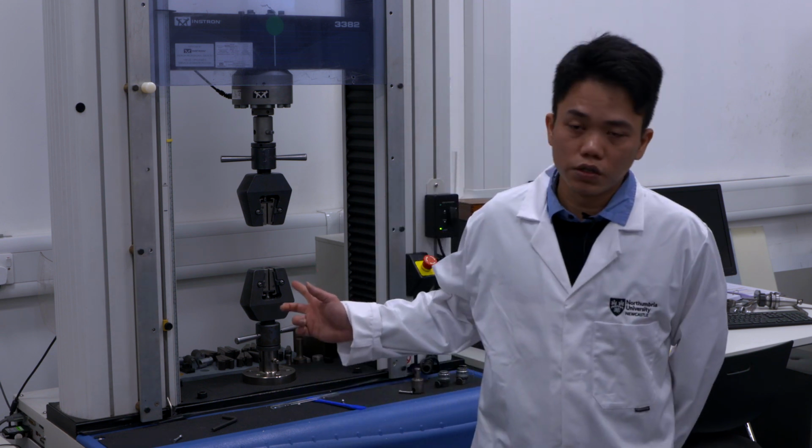A tensile test can give you a view of how strong the material is and how much the material can elongate under the load. Basically, the tensile test can be applied on instruments like electromechanical ones, and the one we are using today is the universal tensile test machine. Its name is Instron.